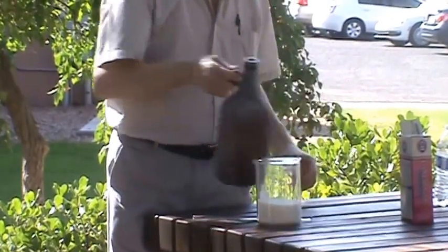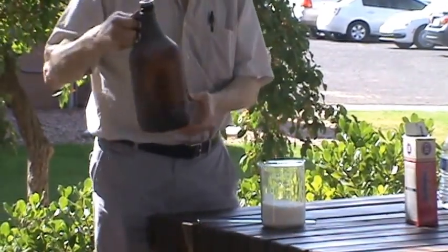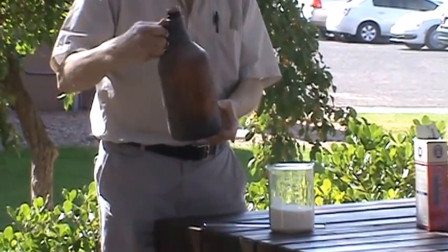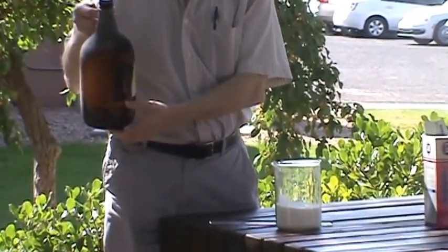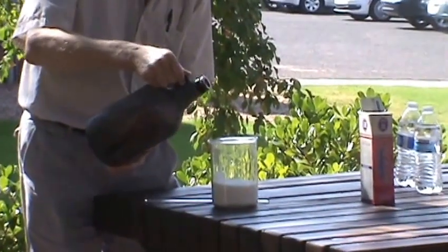I'm going to be adding sulfuric acid. I hope this sulfuric acid is — I know it's not fresh, as you can tell from the bottle. It looks like something from the movie Young Frankenstein. But I hope it's powerful enough to do the demo.